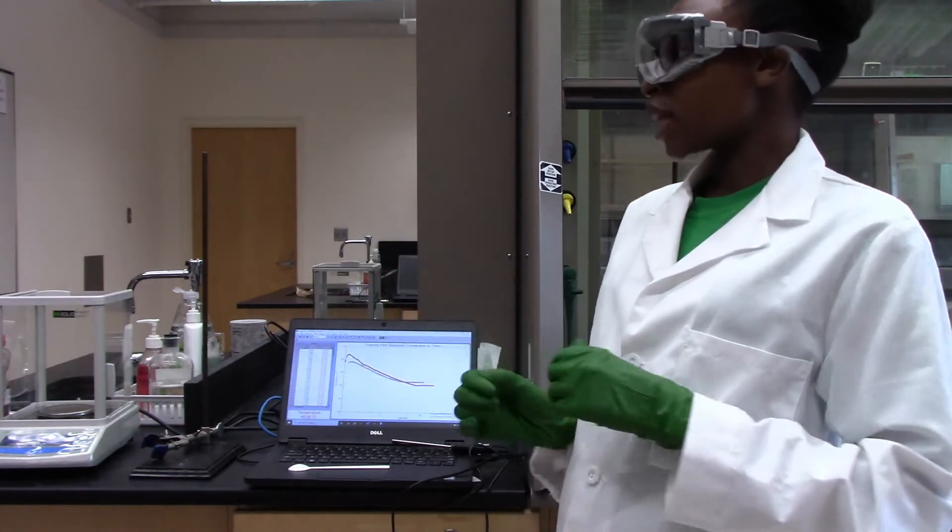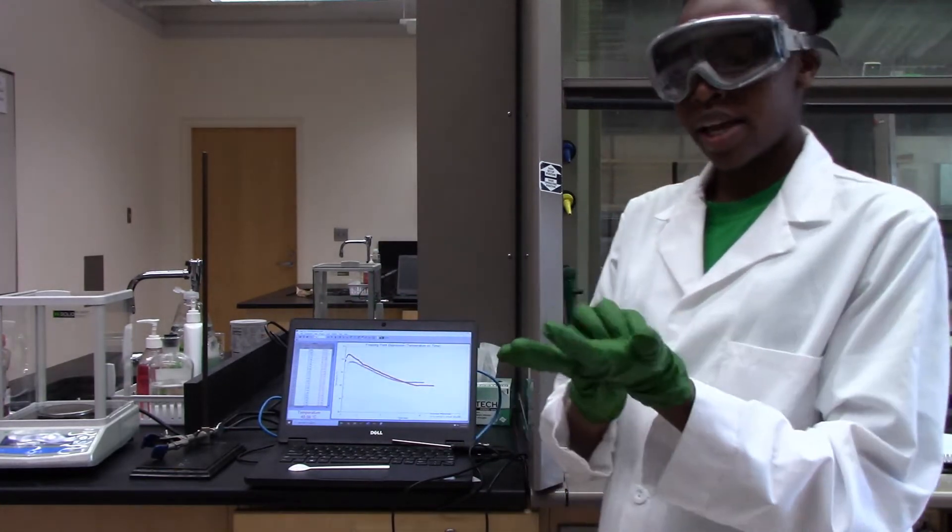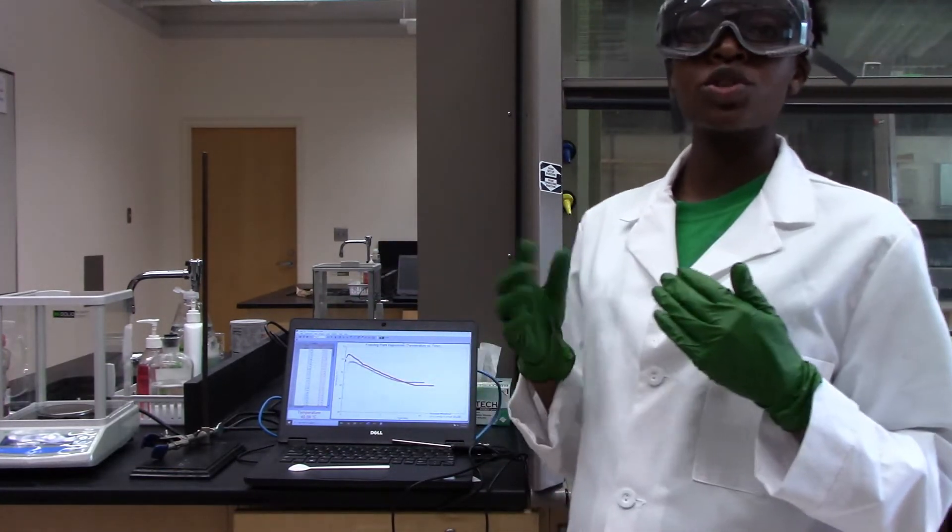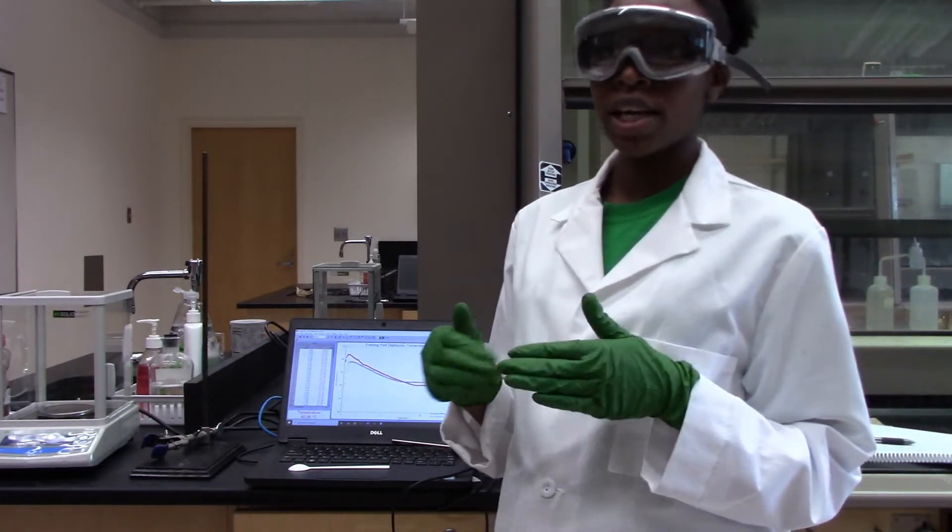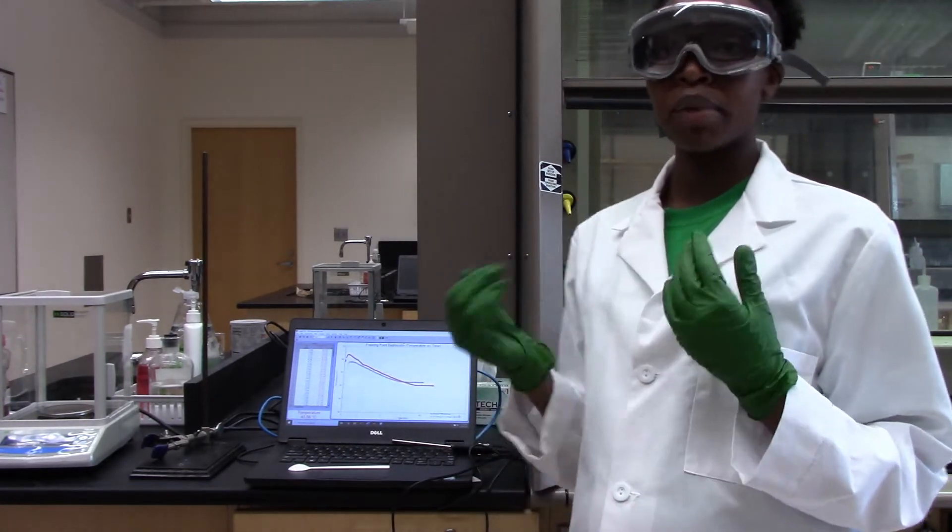Today we have the compound lauric acid that we are going to measure its freezing point by itself. And then when we add a solute, we expect that the solute is going to affect its freezing point. It's going to lower it by a certain amount.